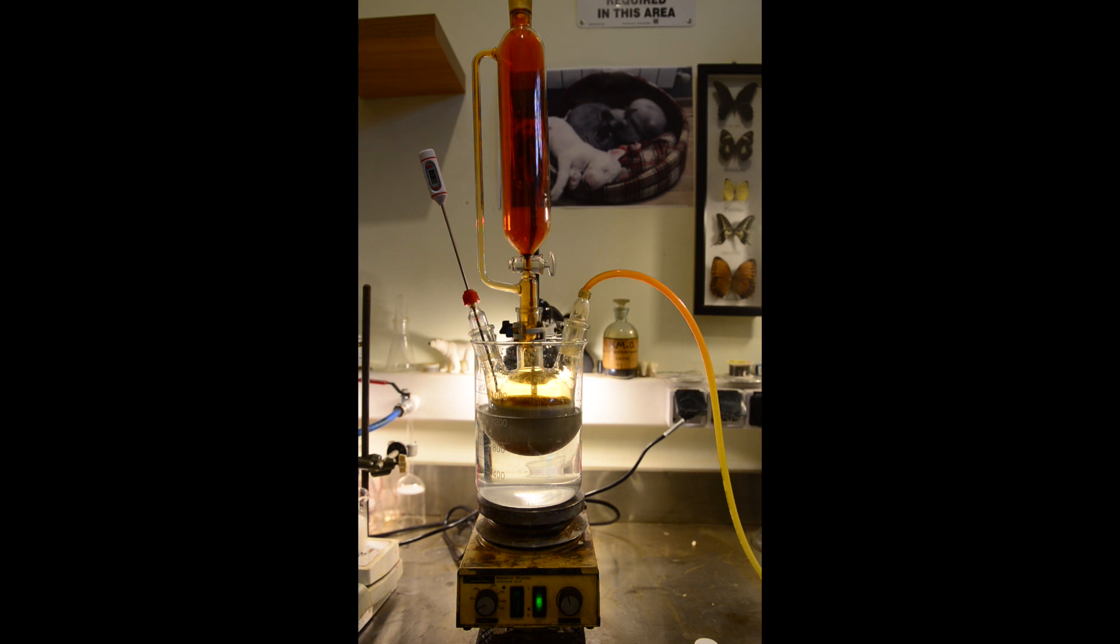Methyl bromide is a very toxic compound and concentrations above 1600 ppm are considered lethal. So sealed apparatus and good ventilation is mandatory. I always forget to mention that I am using a respirator in case of potential contact with such dangerous chemicals.